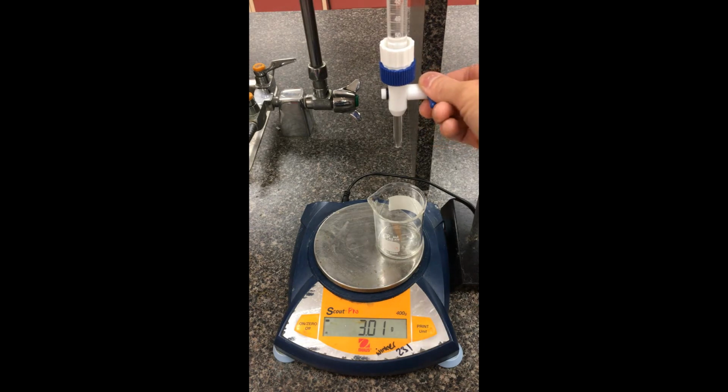Go down another 3 here. Okay, so now I'm at 6.10. Sure, I was a little bit over, but graphically you can just find that point there. So 6.10 on the burette, and then record that mass there. Let's go down to 9 milliliters. Okay, this one I'm getting 9.05, also plus or minus 0.01. The mass there is 8.97.